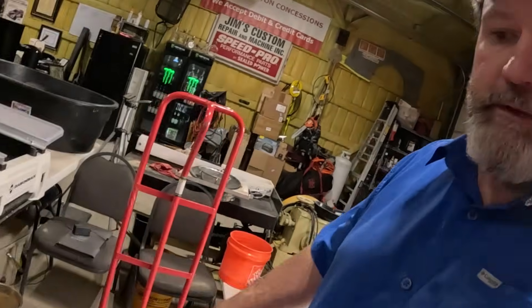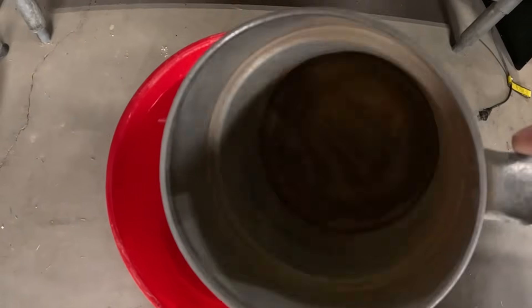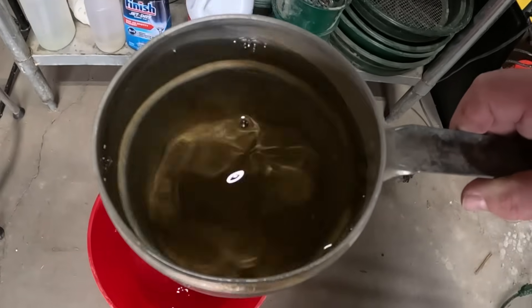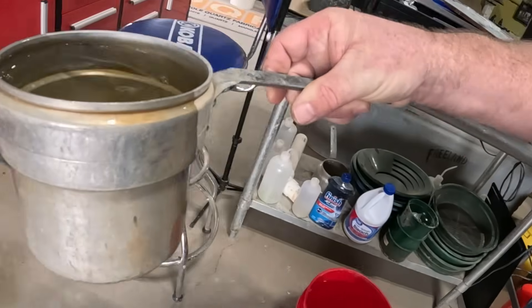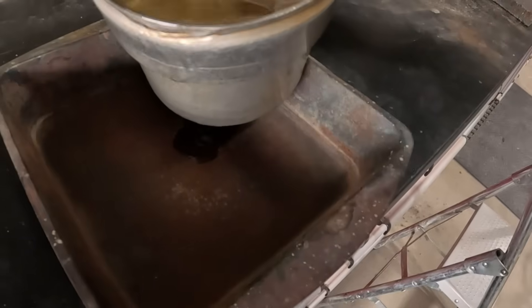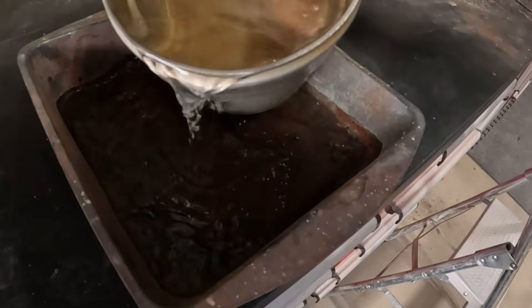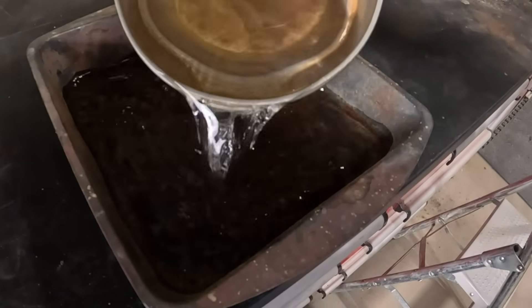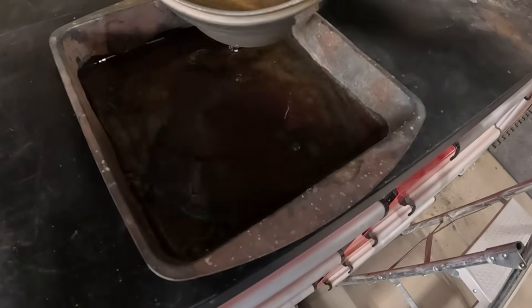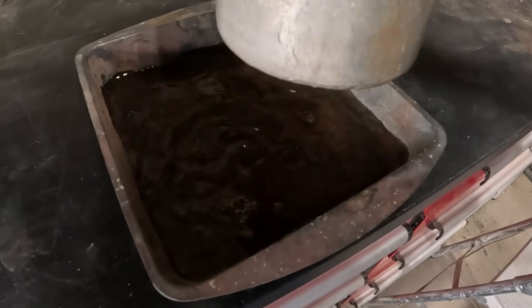Quick update — this is just five gallons of water. Going to get some out of here with my water scoop. We're just going to pour some of it in this pan here. It's just room temperature. We'll fill it about halfway.